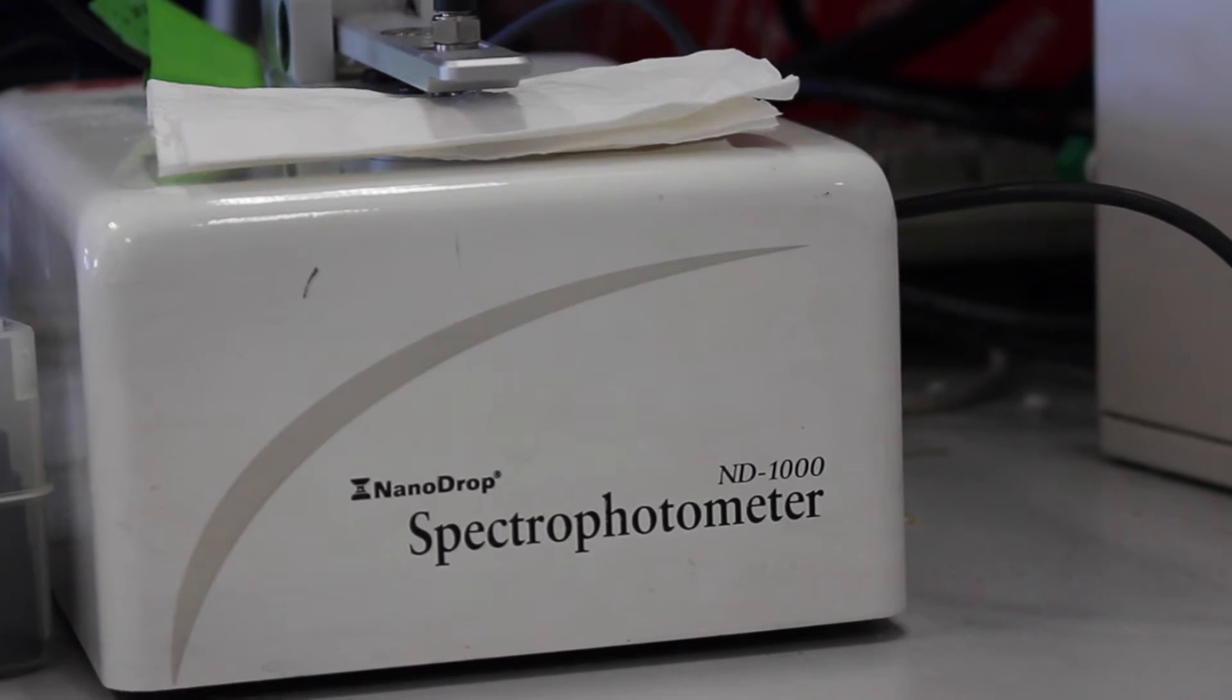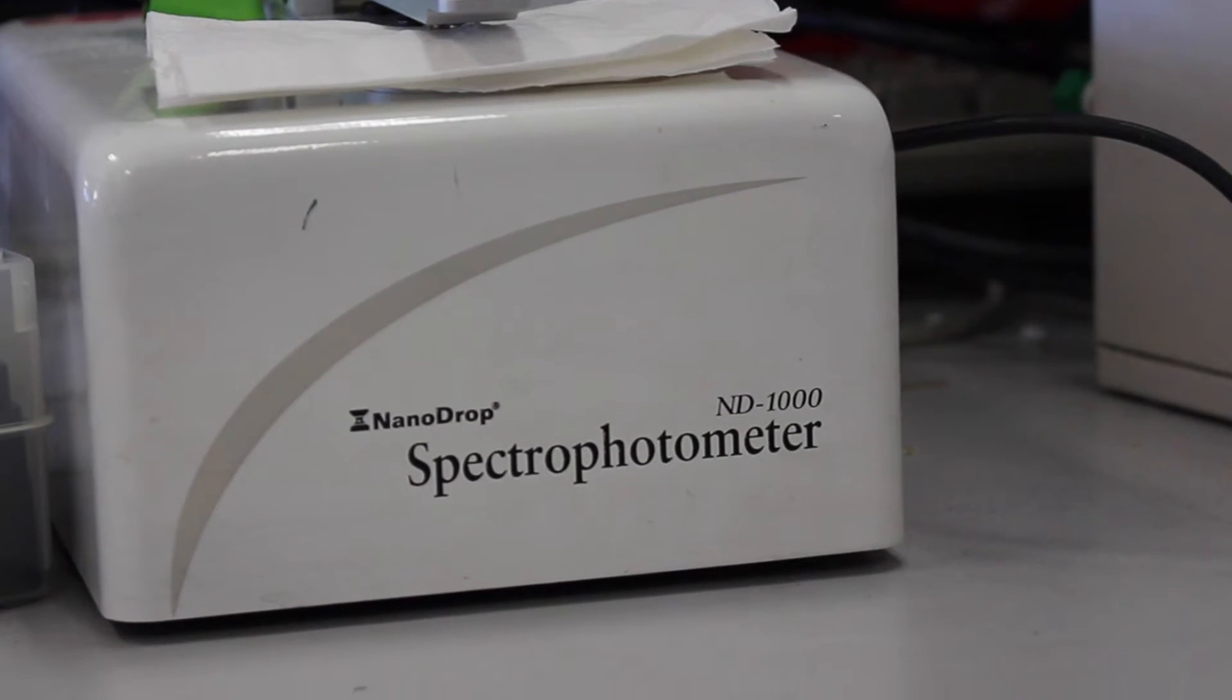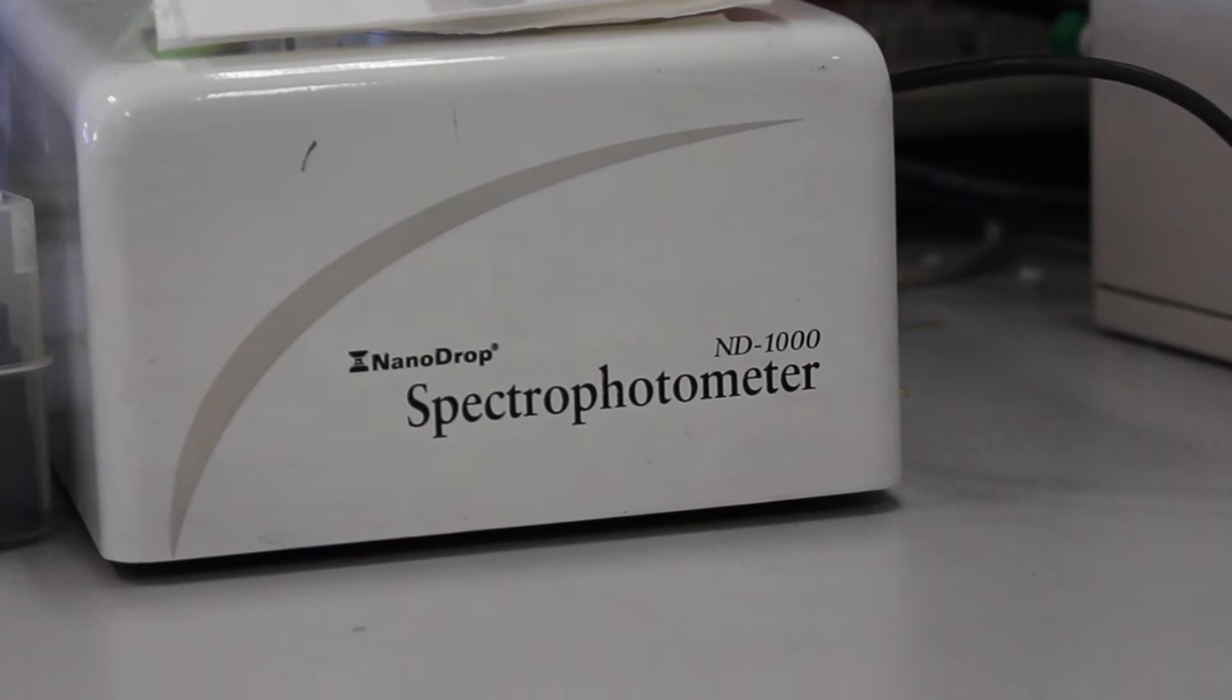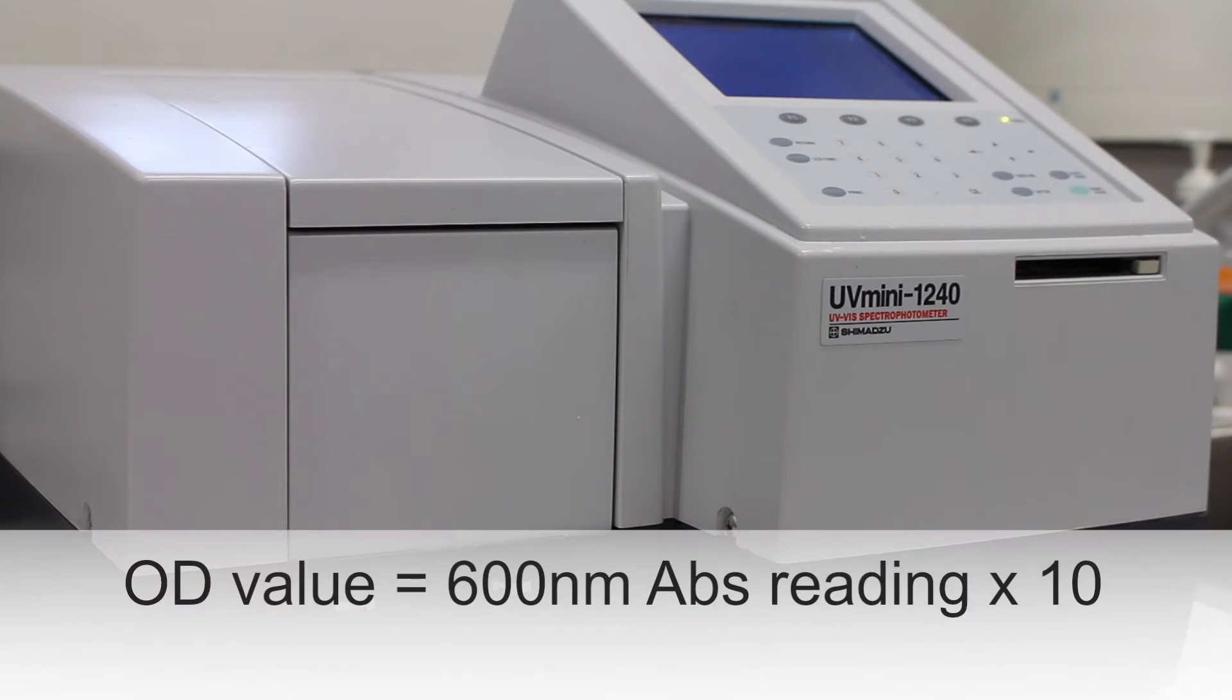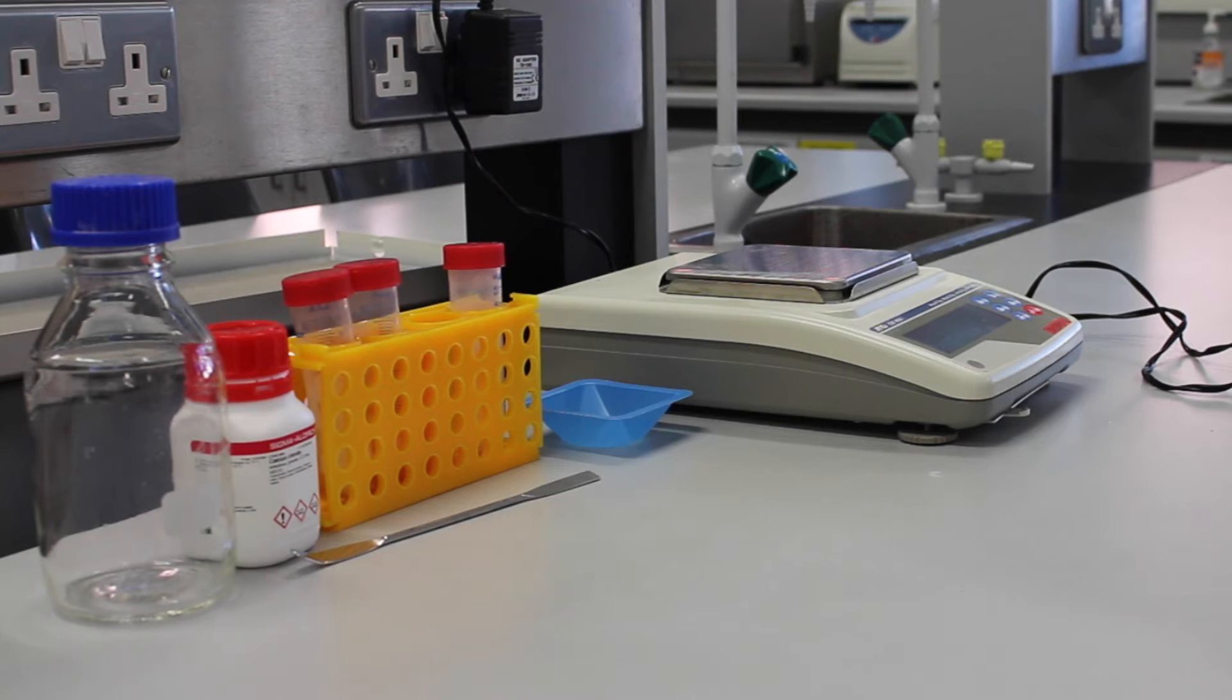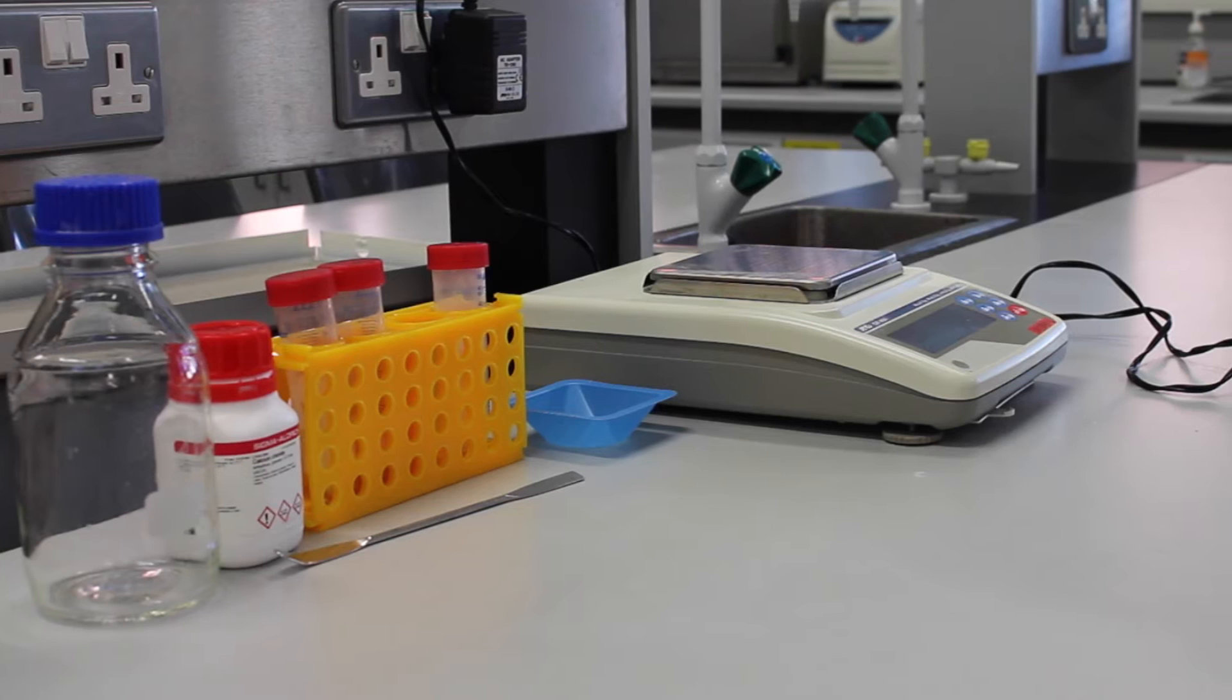Optical density is used for obtaining the concentration of bacteria suspended in SOB. To calculate optical density, the absorbance measured at 600 nm is multiplied by 10.